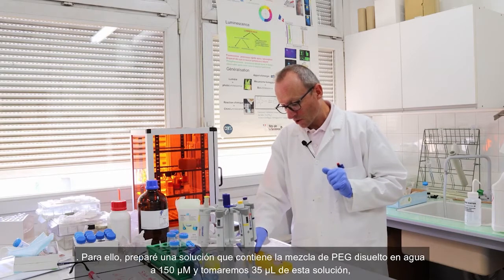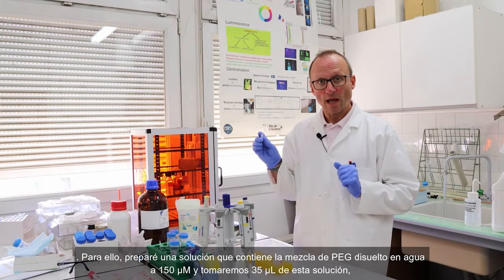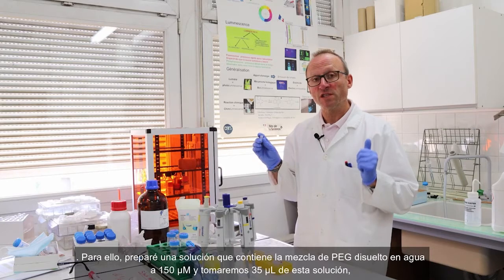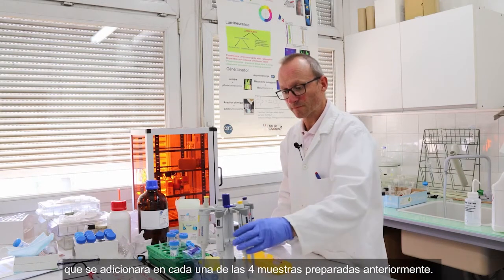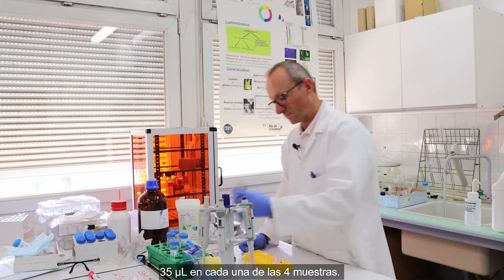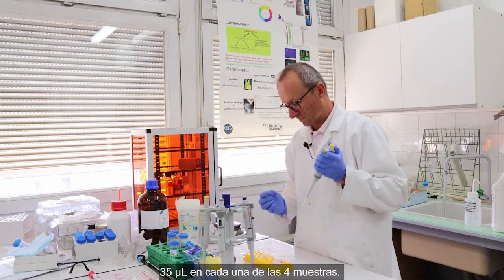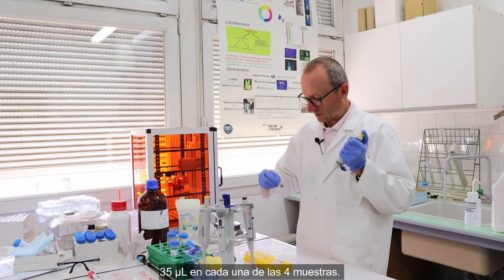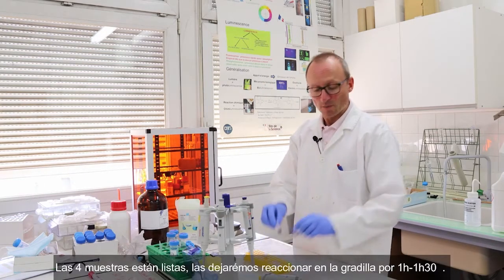To do that, I prepared a solution containing PEG dissolved in water at 150 micromolar, and I will take 35 microliters of this solution that I will add in each of the 4 samples I prepared earlier. 35 microliters in each of the 4 samples. So now the 4 samples are ready.